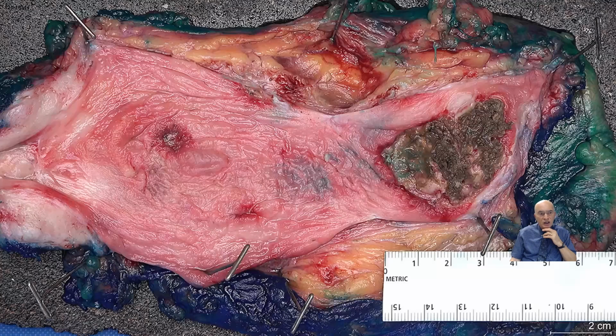This is another bladder. Here is the urethral margin. Here there are some lesions, most likely ulcerative lesions, not necessarily tumor. And this also likely could be a tumor, but sometimes the sequela of a previous surgical procedure can look like this, especially if it's been recent. So, of course, we need to do a thorough sampling of these areas just to see if there is some kind of residual tumor.